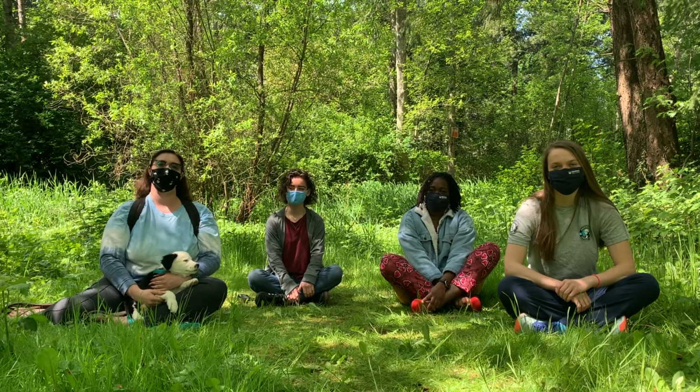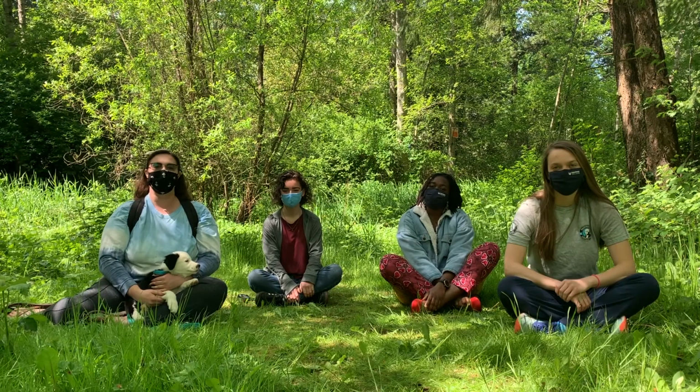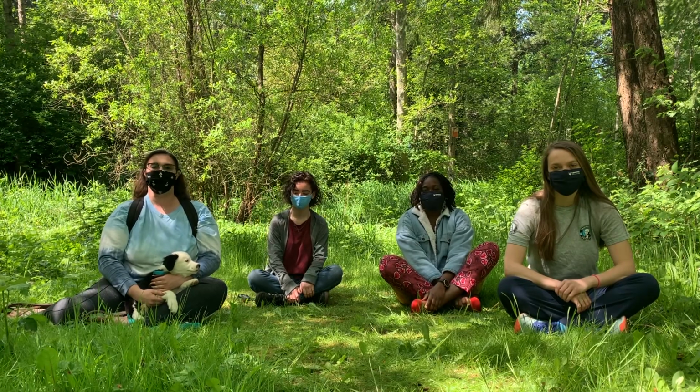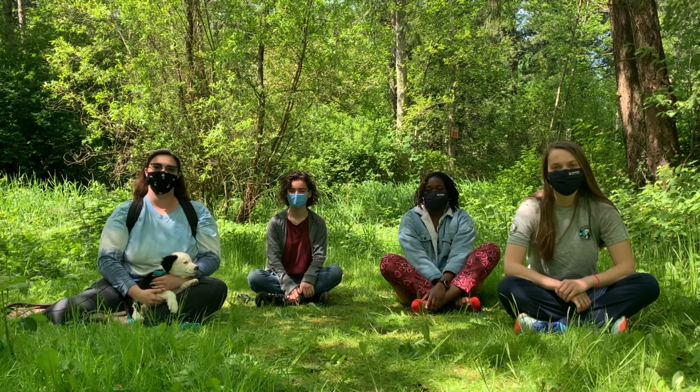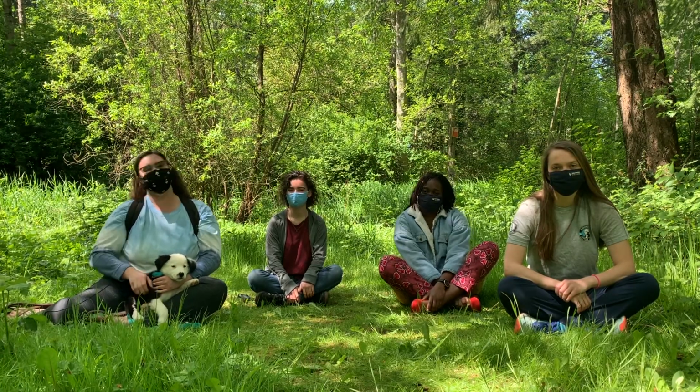Today we're going to take you on a virtual field trip to the creeks of Big Gulch and Japanese Gulch, located in Mukilteo, Washington. Today we're going to show you some practices that we've been using to monitor our local watersheds. And with that, let's go!